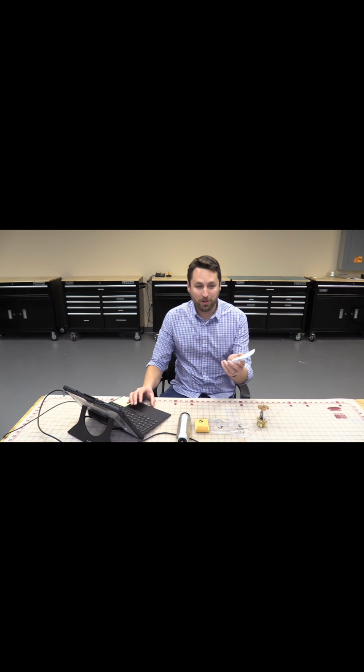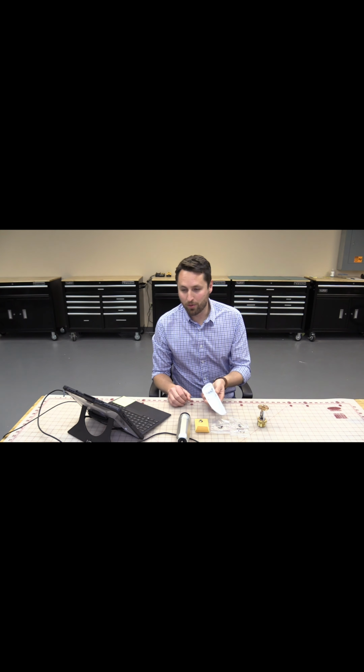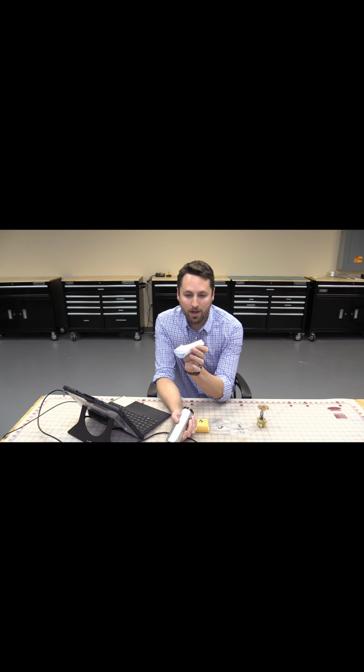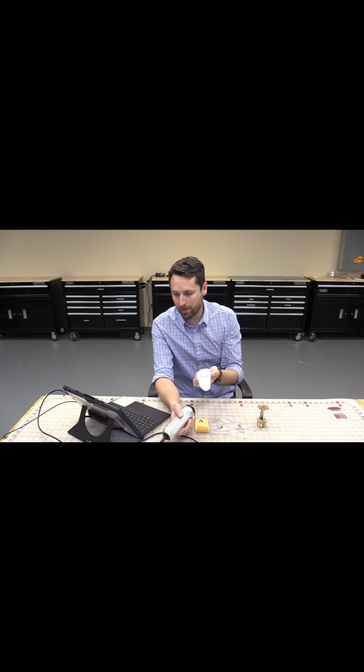Another component that we've looked at using the GelSight was this water filter cartridge. So I wanted to give a little bit of a talk on some of the things that we were able to see using the GelSight here as well. On the fracture surface, we have a lot of different features, a combination of some brittle features and then also some ductility that we're able to see.